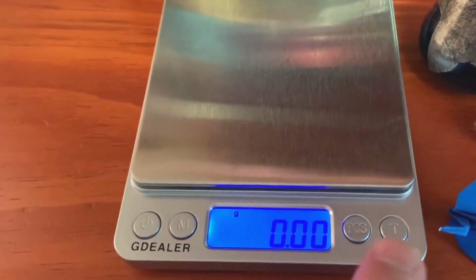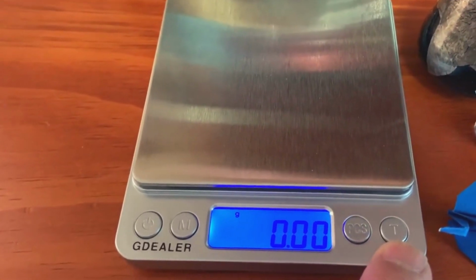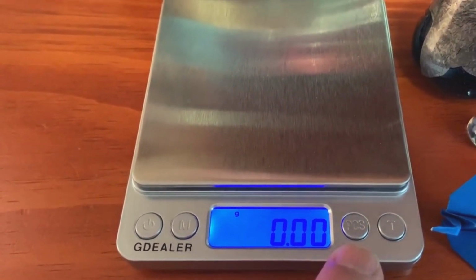A little bit later, I'll show you what the T button is. That's something called tare, but you don't need to worry about that right now. And this PCS button is to calibrate your balance. Again, you don't really need to worry about that.